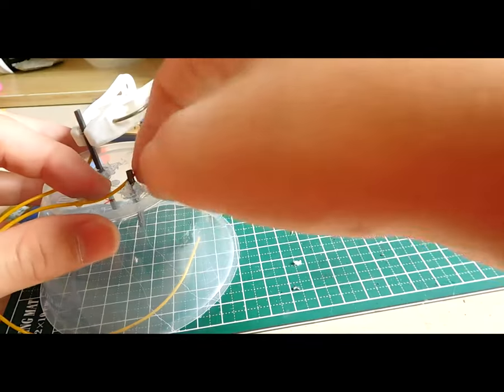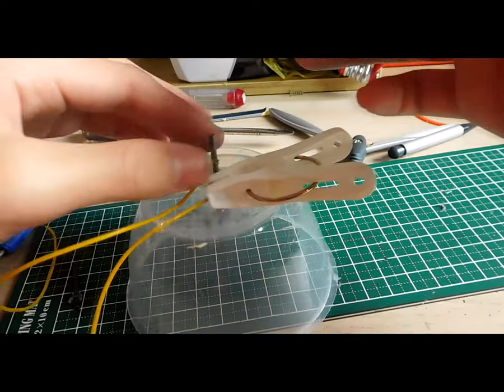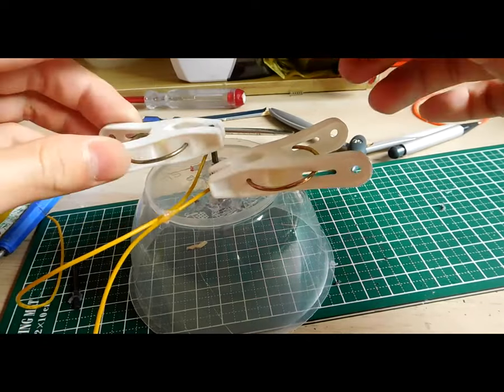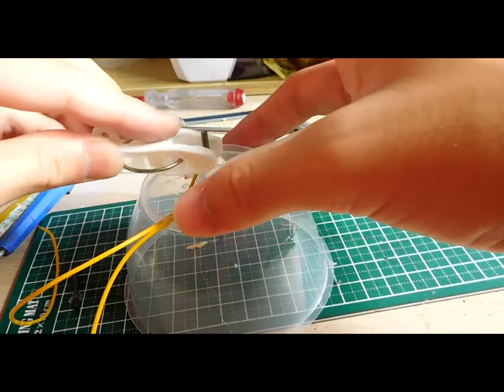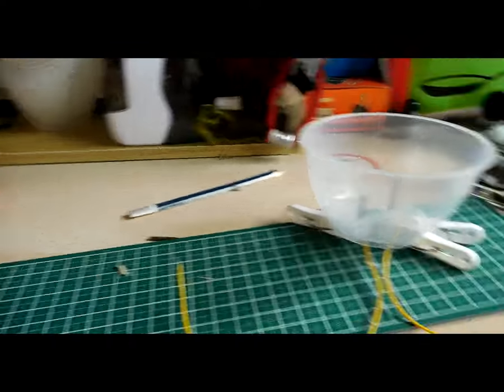Once the positive is connected, I can now connect the negative wire. Now I have to add the last alligator clip to the negative wire and trace this thing to the other side. Once the clip has been fit snugly, now we have to get some water.